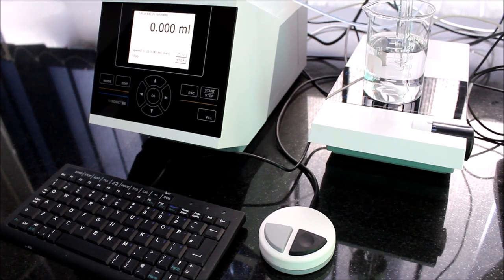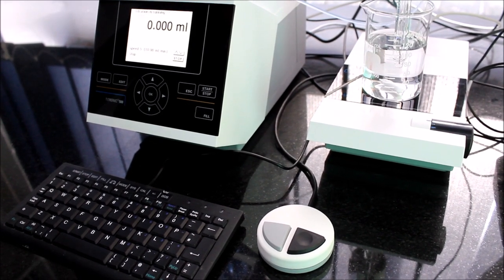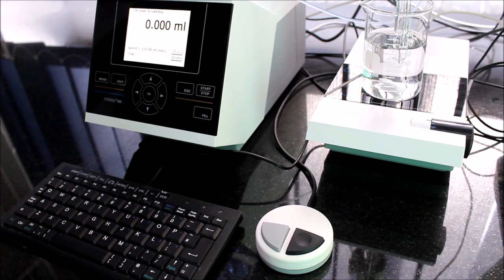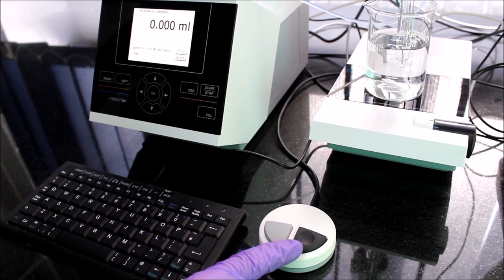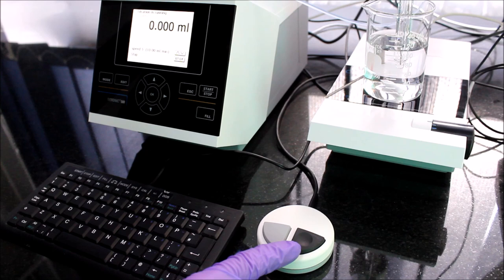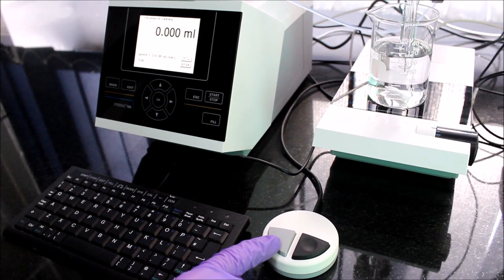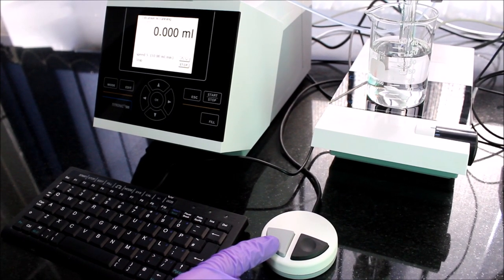For controlling the titration, a special mouse is used which consists of two buttons. The right dimpled black button delivers the specific amount of titrant solution, while the left round gray button ends the titration process.